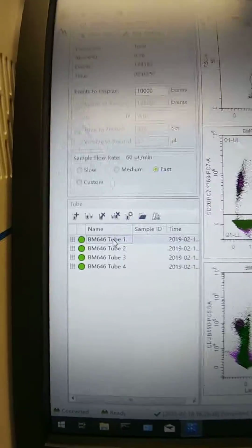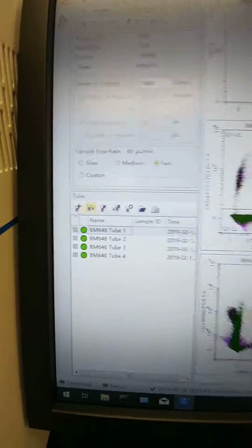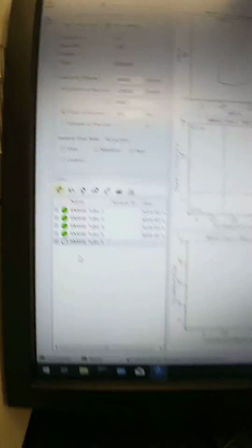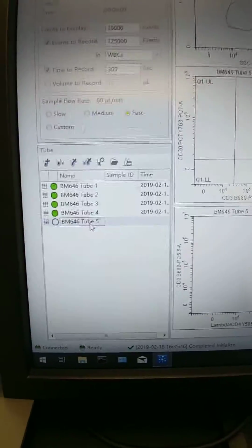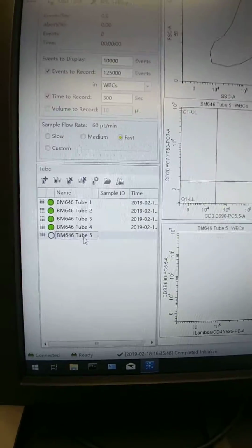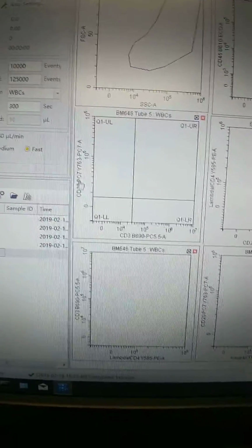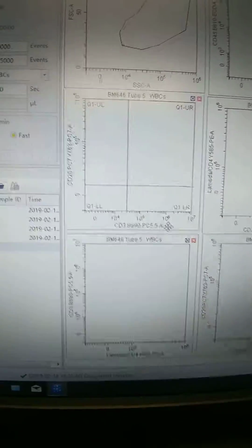So what I'm going to do next, I have here this tube 1 highlighted already. So I'm going to click here on the little picture of the single tube with a plus. And that gives me a tube 5 down here. It should be a duplicate of the tube 1. And if you're not sure, you can come over here and see. Alright, CD20 PC7 and CD3 PC5.5 lambda. So that is the antibodies in our tube 1.